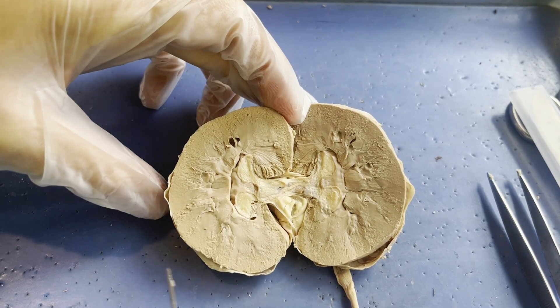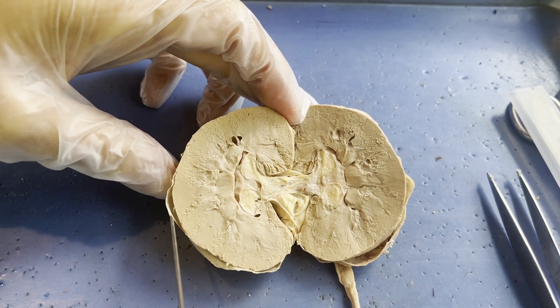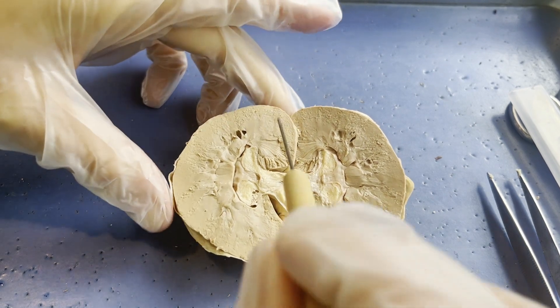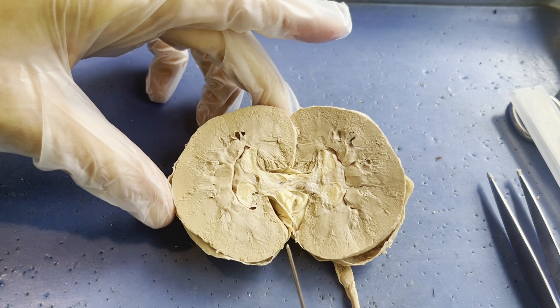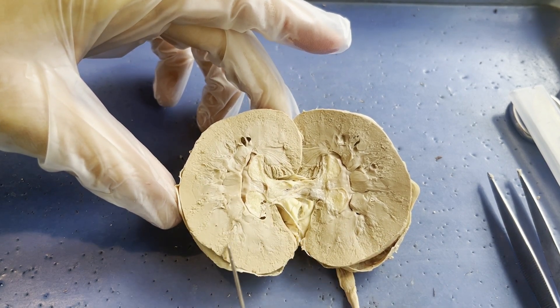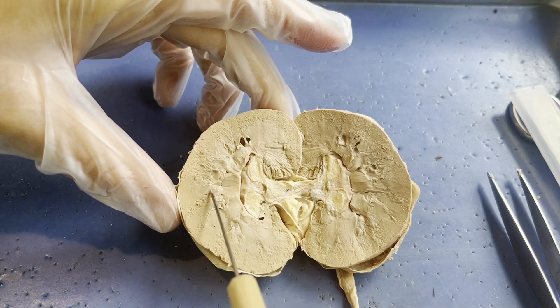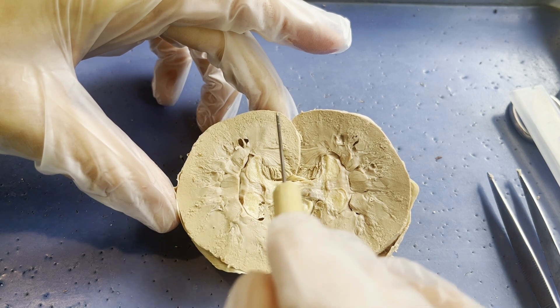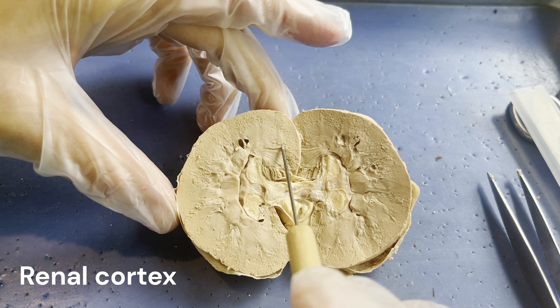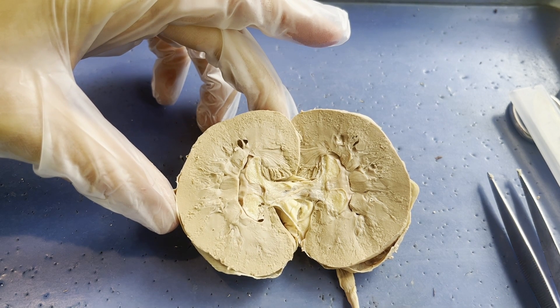Now that we can see inside the kidney, we can see a couple of major components. First, the renal capsule — that outer covering is visible from the inside. Now focus on the bulk of the kidney: on the outside there is a lighter colored tissue, and on the inside there is a darker, almost smoother type of tissue. The outer layer of each kidney is known as the renal cortex, and the inner layer is known as the renal medulla.